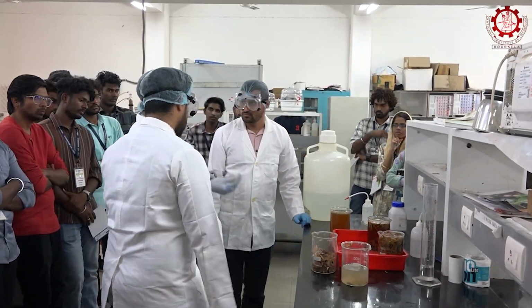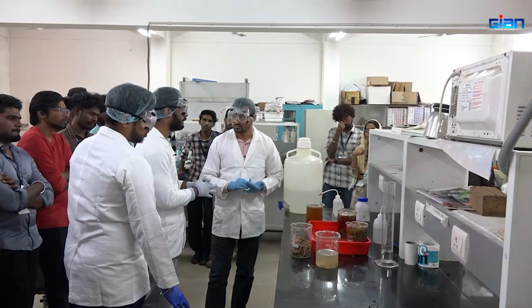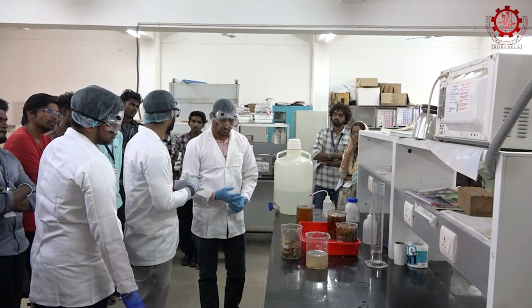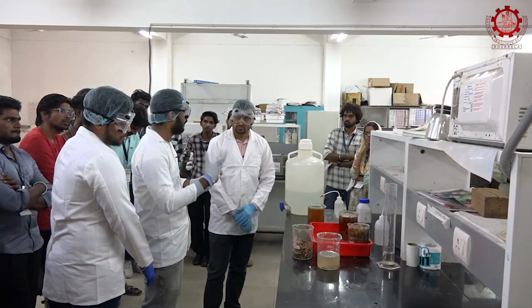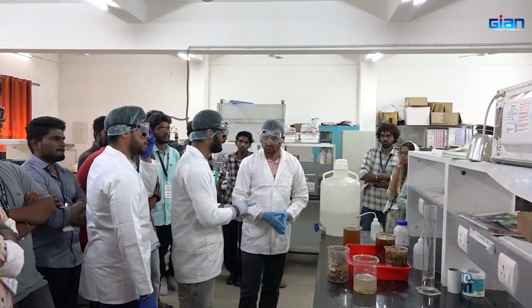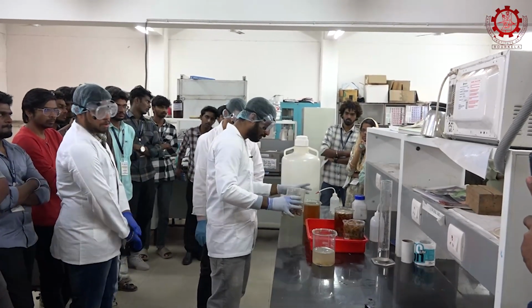For example, for the mass balance we have to evaluate the concentration of calcium chloride. If we have carbon dioxide sensors, we can also evaluate from the amount of carbon dioxide released from the shells. After proper washing, we got it.